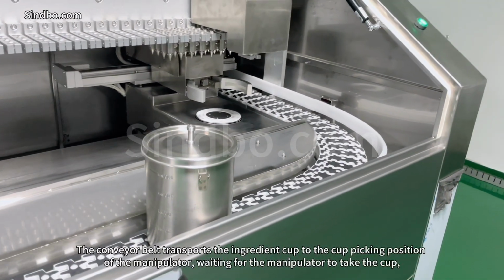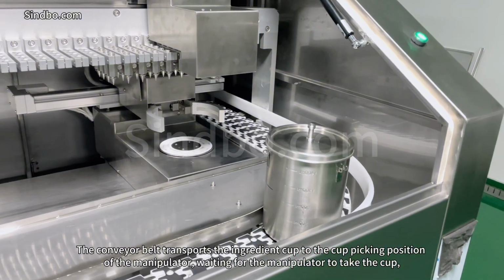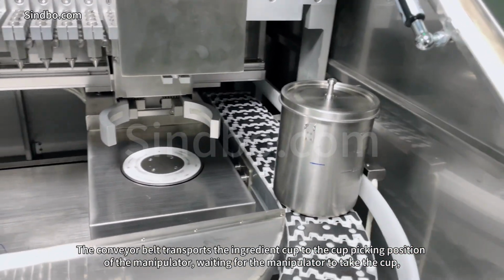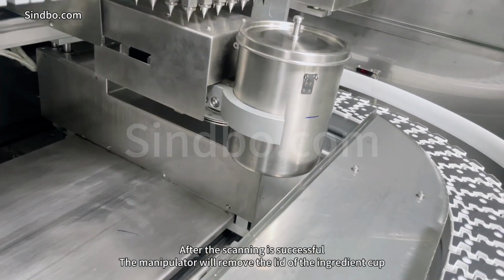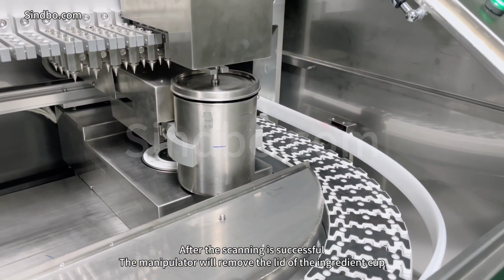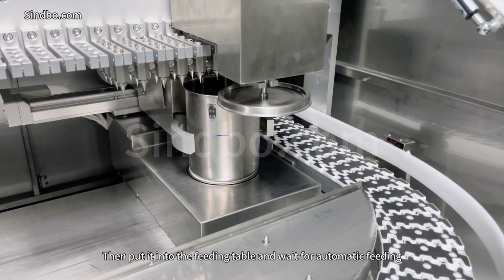The conveyor belt transports the ingredient cup to the cup picking position of the manipulator, waiting for the manipulator to take the cup. The manipulator will deliver the ingredients to the QR code scanning place for scanning. After the scanning is successful, the manipulator will remove the lid of the ingredient cup, then put it into the feeding table and wait for automatic feeding.